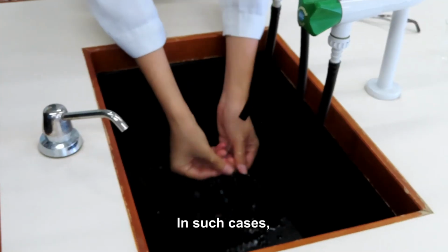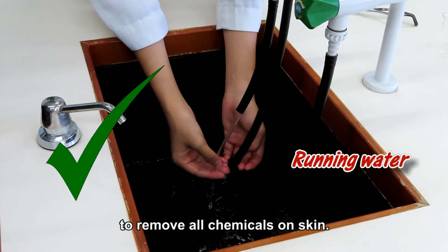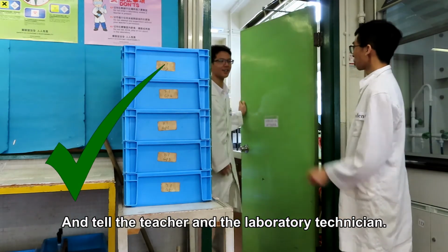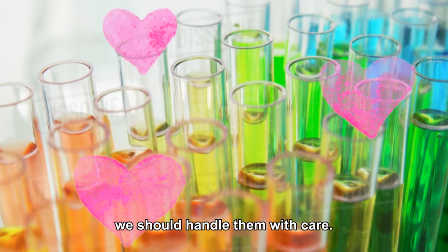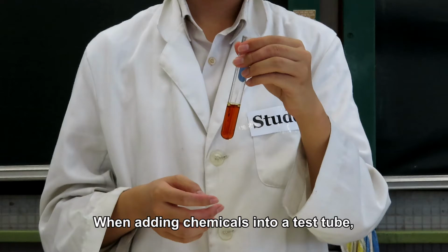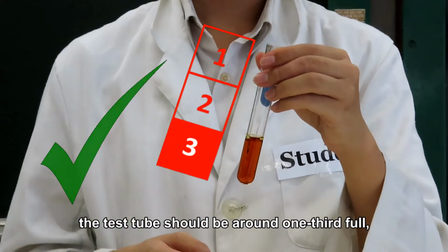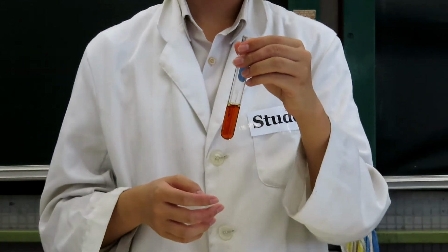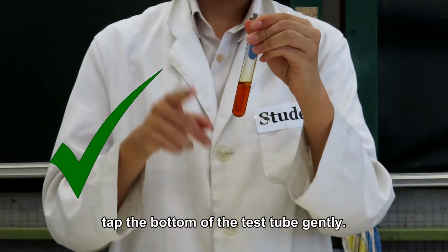In such cases, wash the affected area under running water to remove all chemicals on the skin and tell the teacher and the laboratory technician. To prevent spilling chemicals, we should handle them with care. When adding chemicals into a test tube, the test tube should be around 1/3 full and must not be more than half full. If you have to shake the chemical, tap the bottom of the test tube gently.